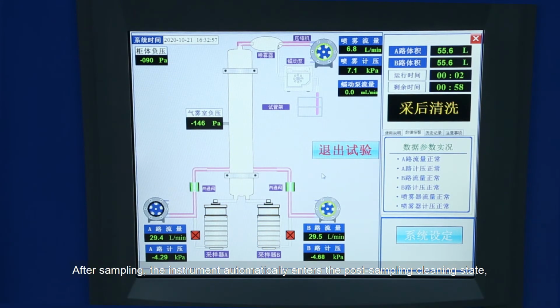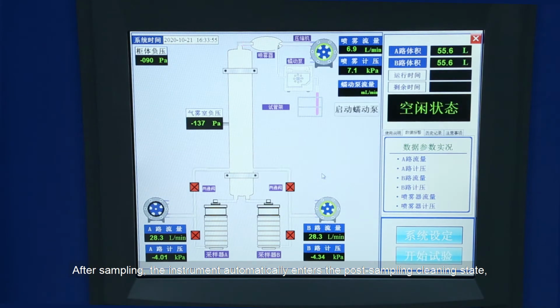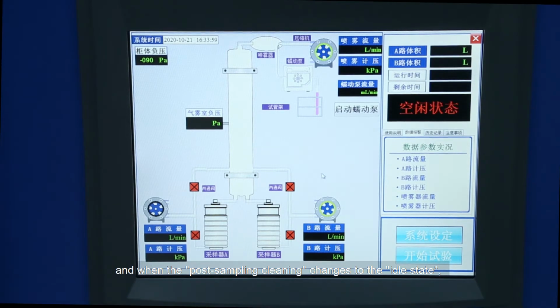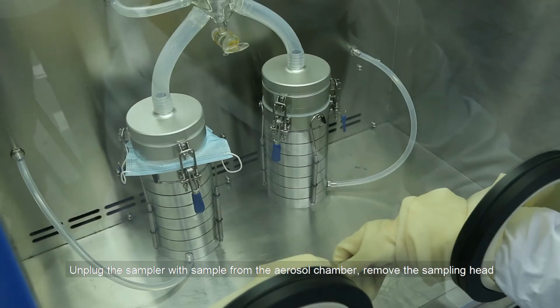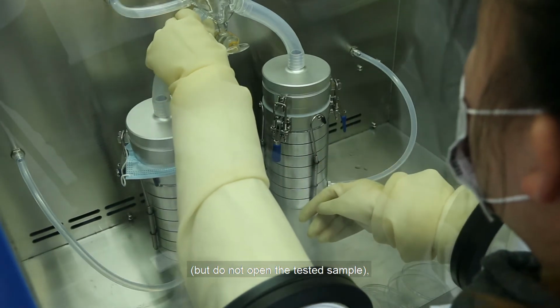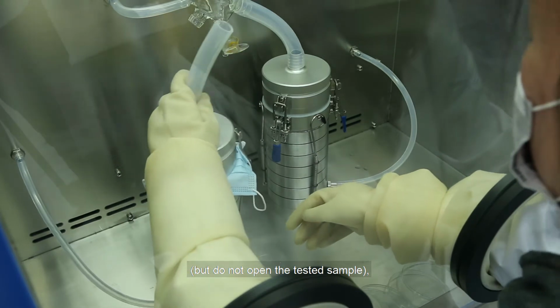After sampling, the instrument automatically enters the post-sampling cleaning state, and when the post-sampling cleaning changes to the idle state, the self-cleaning is completed. At this time, the first group of sampling is completed. Unplug the sampler with the sample from the aerosol chamber. Remove the sampling head, but do not open the tested sample.